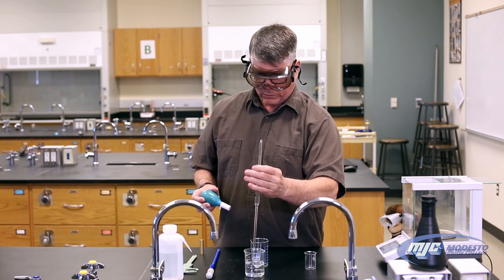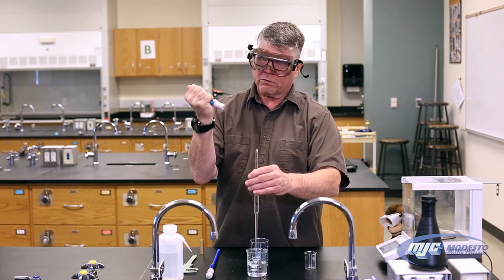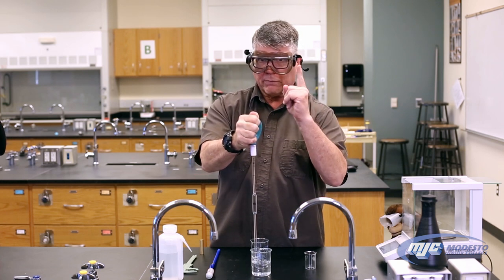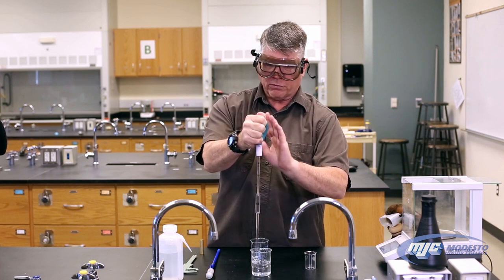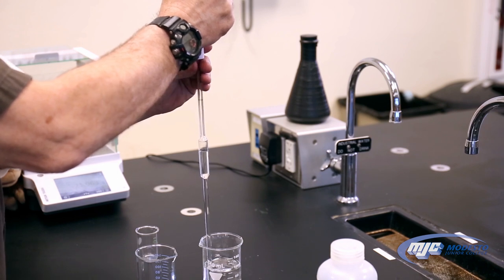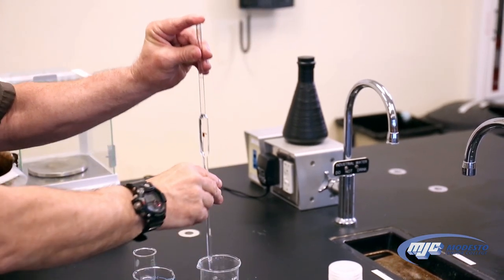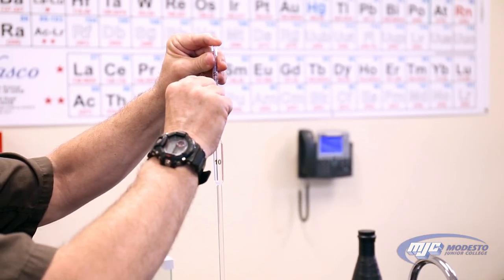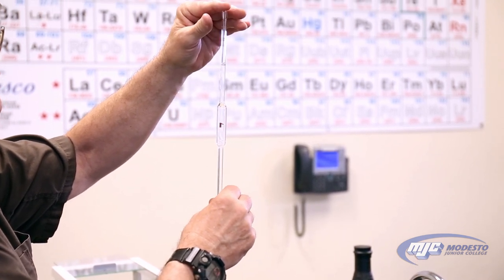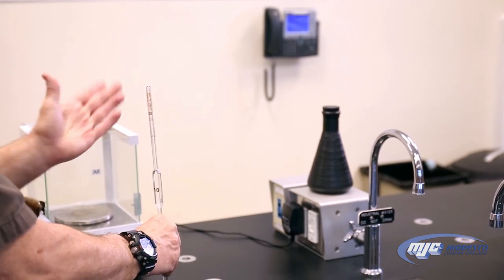We use our finger to make the meniscus at the top of that column of water just touch the top of that line — that'll be 10 milliliters. Put the pipette in the water, lift it a little off the bottom, squeeze the bulb and keep it squeezed. The inside of this bulb is an inverted cone, so move it around to find where it fits best. Left forefinger goes here; make sure it's dry and there's no water on anything. Start releasing the bulb — it pulls the water up past the mark. Once past the mark, take the bulb off quickly, put your finger over the top to keep it from falling out.